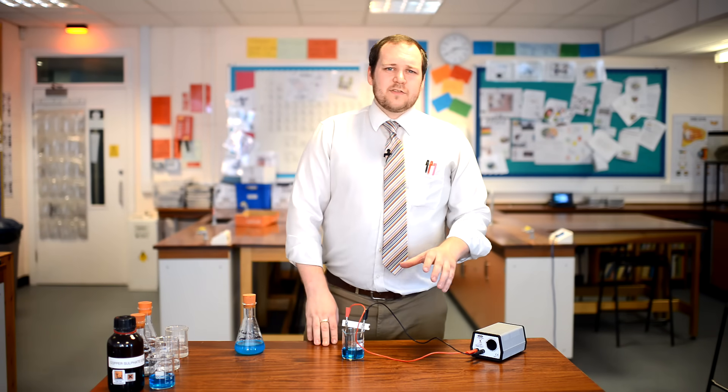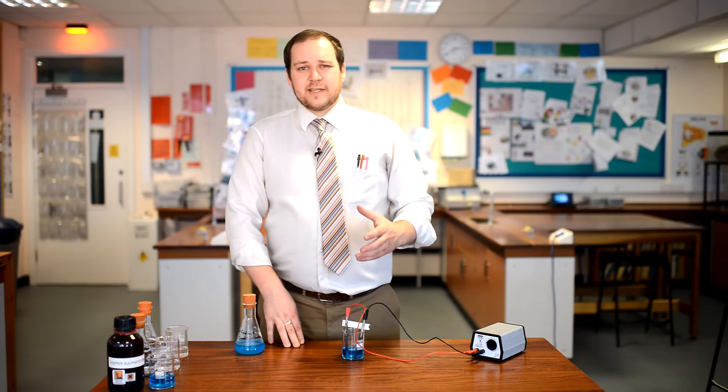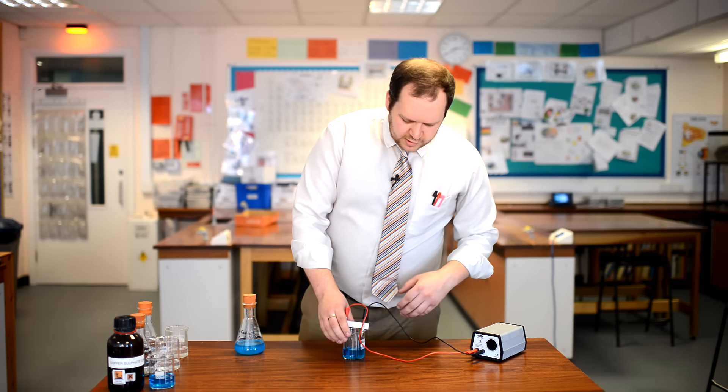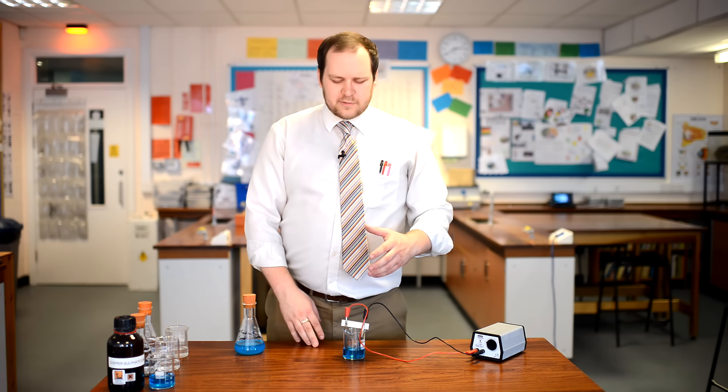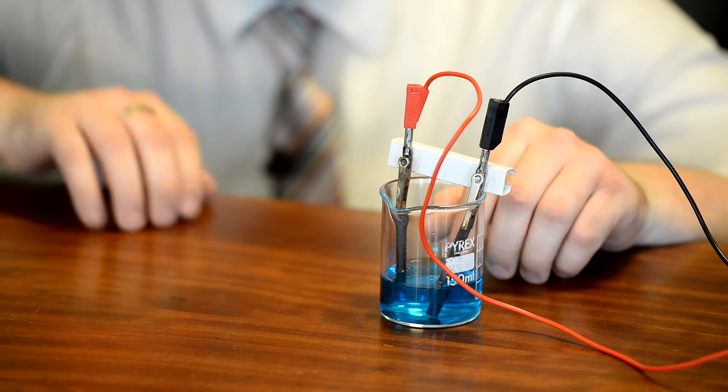When you leave it to run, you need to leave it to go for about 5 minutes just to make sure you've got enough of the element to test it properly. And what we're going to do is look over that time period what happens in the electrolyte. Our electrolyte here is the copper chloride.